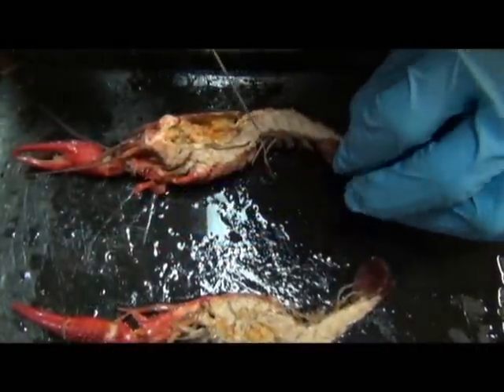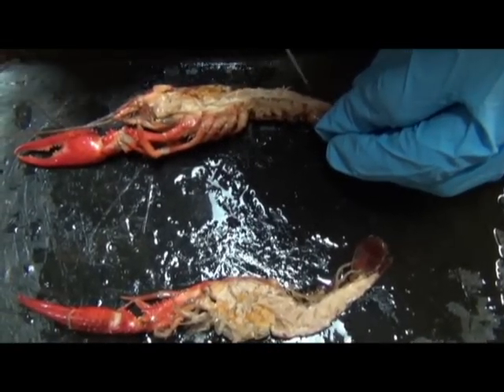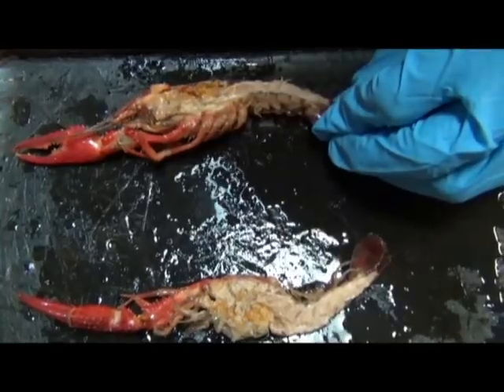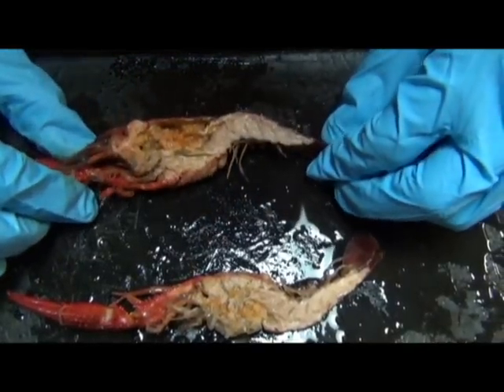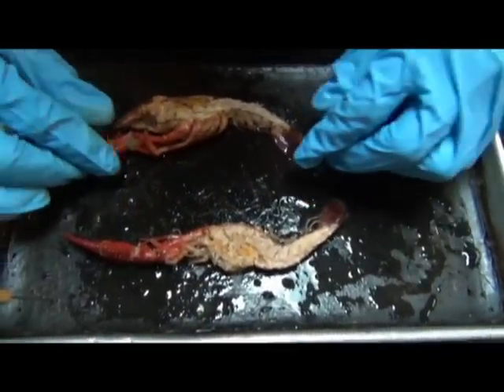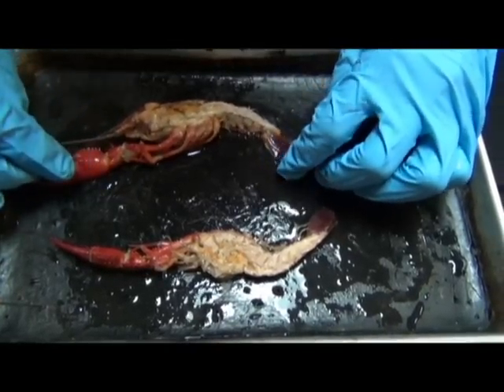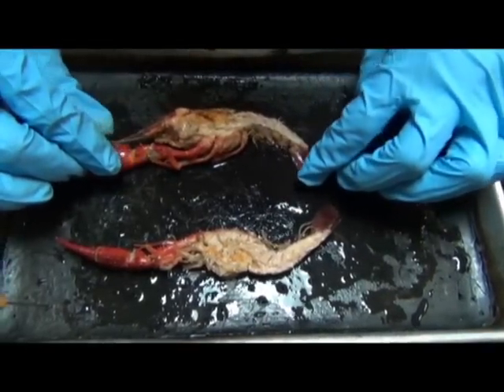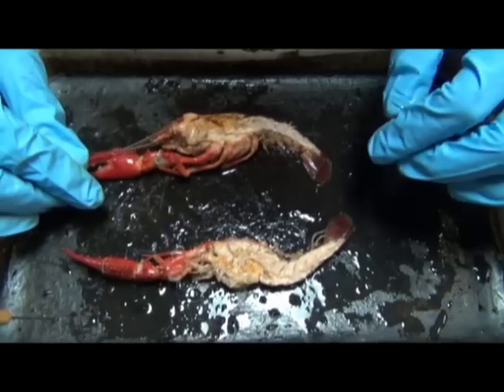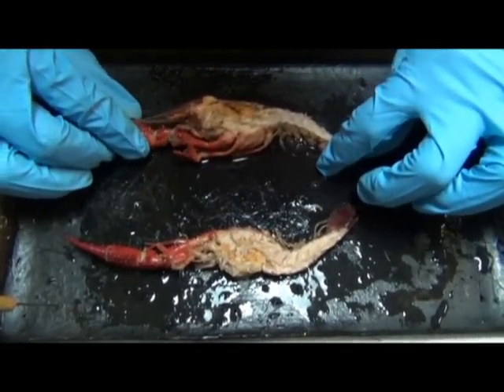Okay, and then here is where you would find the ventral solid nerve cord of the animal. Okay, so what else do I want to mention here? Well, I think we'll leave it at that for now. We can go into more detail. If you're interested, there are plenty of resources that we'll make available.